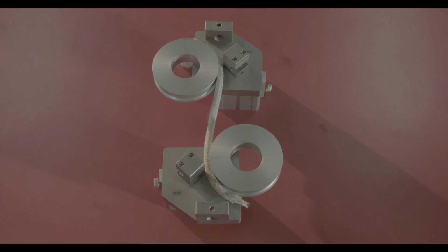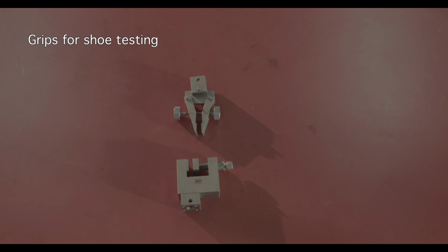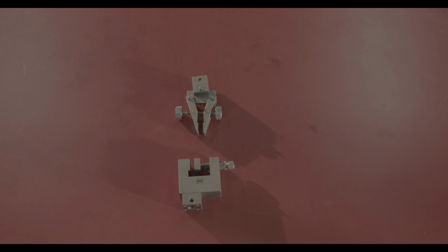Cord grips. Pneumatic action upper and lower cord grips are used to measure the tensile behavior of textile cord. Webbing grips. Upper and lower split roller self-tightening webbing grips are used to measure the tensile behavior of textile webbing. Grips for shoe testing. One bottom serrated shoe hold grip and one self-aligning shoe peel pincer are used to measure the tensile behavior of shoes.